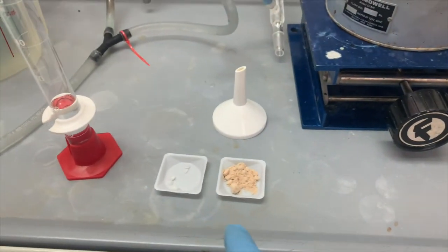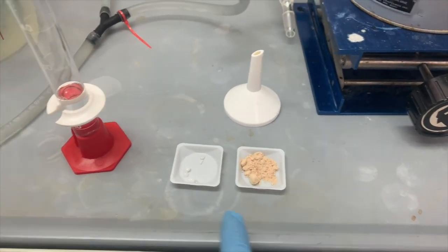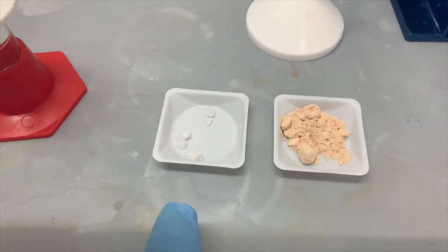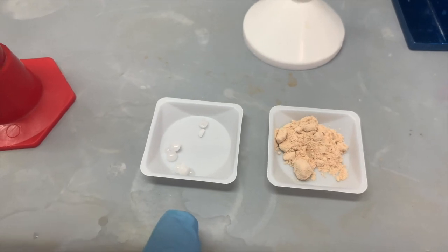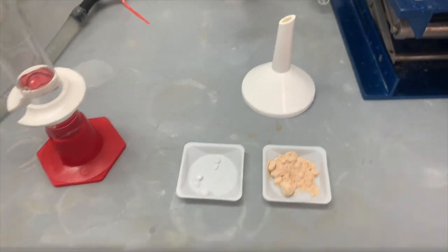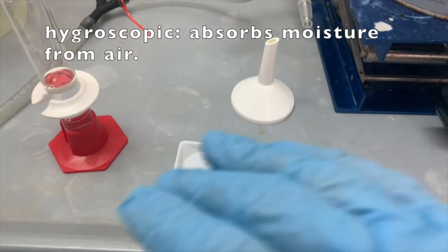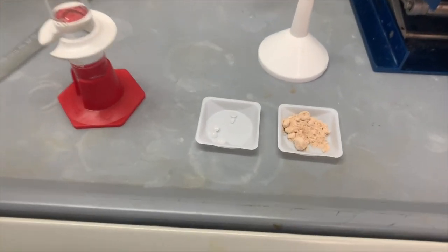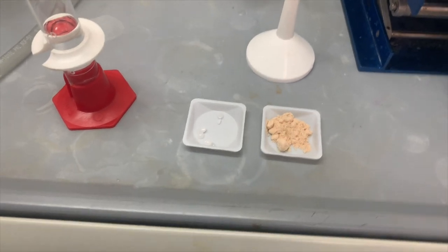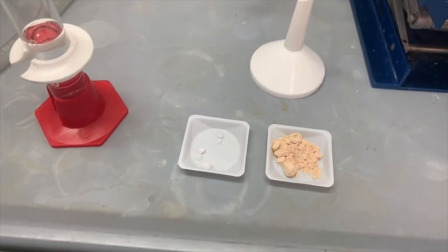Here we have our reagents. That's 2-naphthol, 1.00 grams of it. That's sodium hydroxide, 0.56 grams. Look, it has kind of a glistening appearance. That's because it's very hygroscopic and it's picking up atmospheric water to create that glistening surface. But don't let that beautiful appearance fool you. That is nasty stuff. If that gets on your skin, that's going to burn like crazy. So be very careful with the sodium hydroxide.